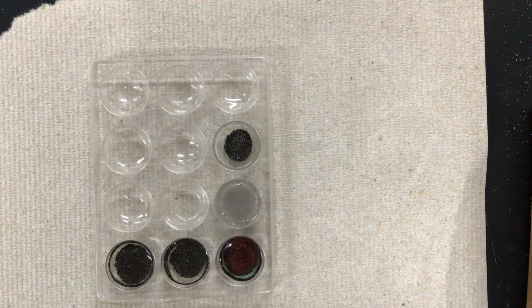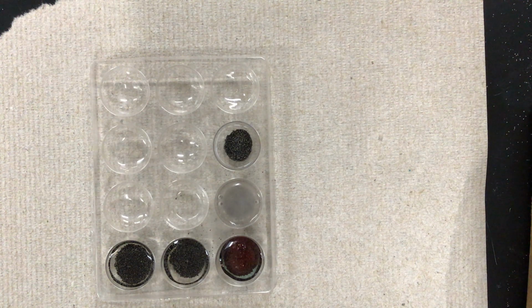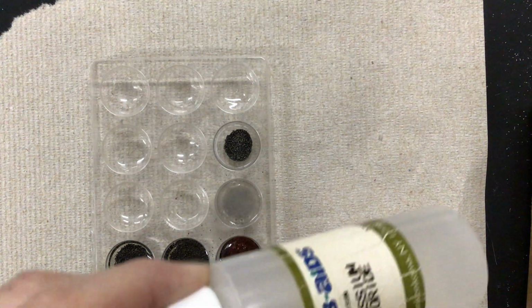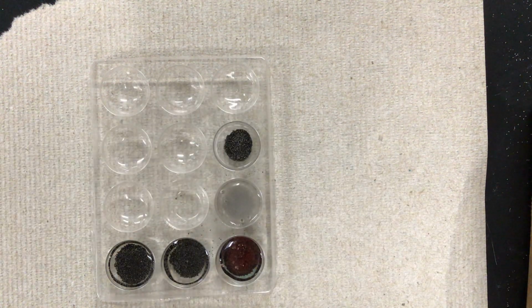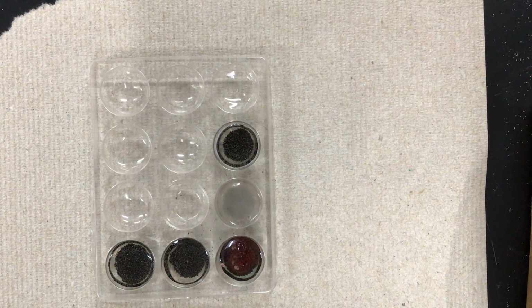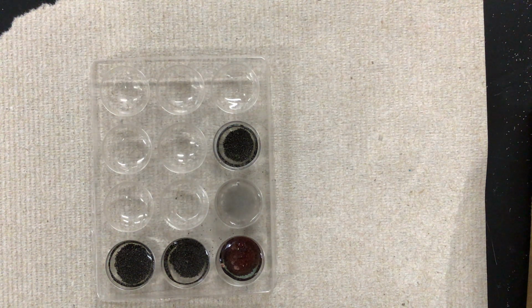We'll let that go for a few more seconds to make sure that it finishes reacting before we do our next one. But again, that's a very pungent, rotten egg kind of smell. That is kind of nasty. All right, and then finally, the last one is potassium chloride, that's KCl. Let's see what happens here. And again, it doesn't look like there's going to be any reaction there.